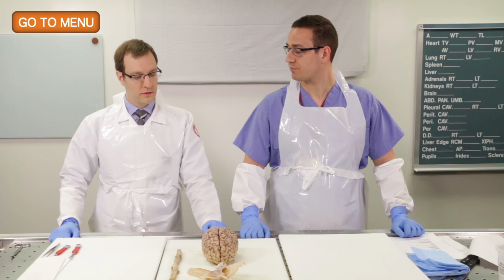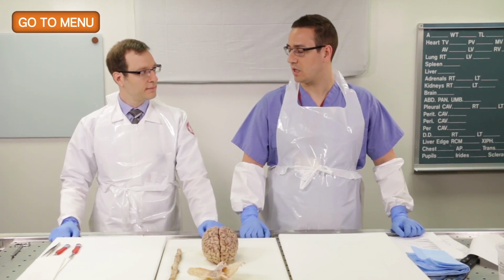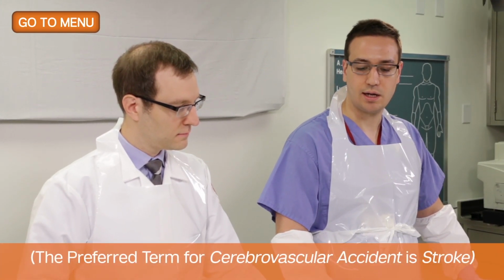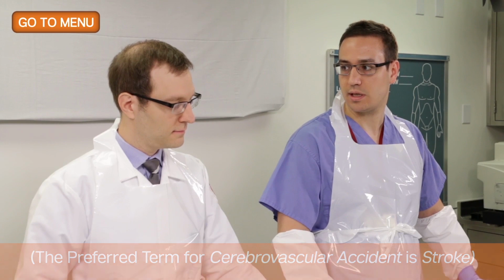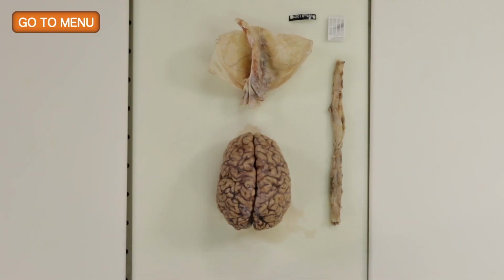Okay. And in terms of her neurological history, does she have any particular neurological history? She does. She has a remote history of a cerebrovascular accident back in the early 2000s that left her with partial motor weakness on the right side of her body. And do we know any details about that? Was any imaging done, for example? We have no imaging here. There was no imaging available.